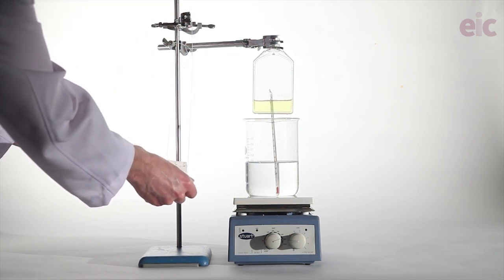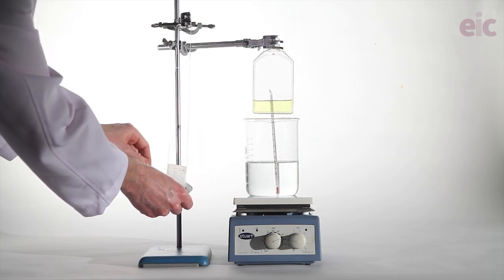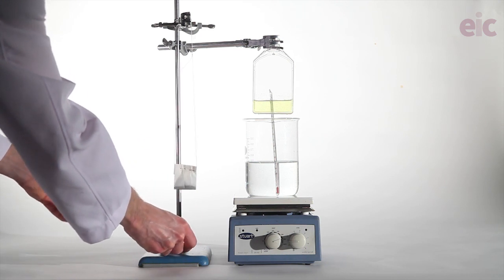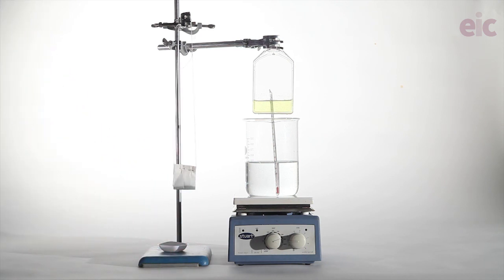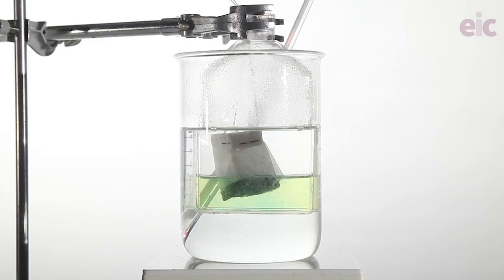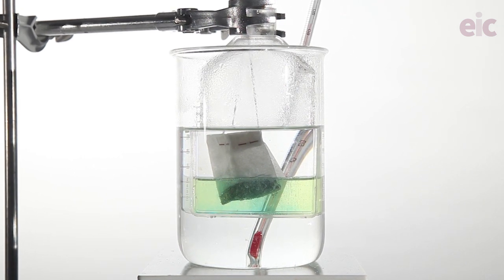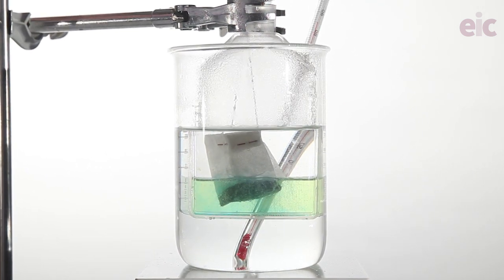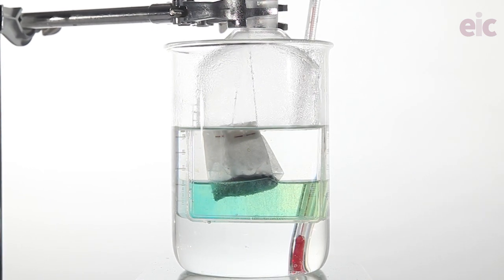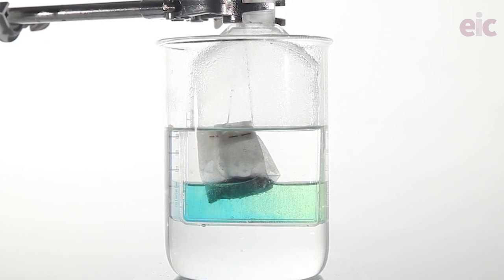Now I can lower in a tea bag, and I'm using one of the sort of string tag tea bags, and that's containing my zinc powder, as mentioned before, a couple of spatulas somewhere between 4 and 6 grams. Use a clamp to hold the tea bag close to the surface of the solution so that bubbles rise away from the color that you want to see below. The lower oxidation states also have higher density, so they will sink through the solution and mix nicely.